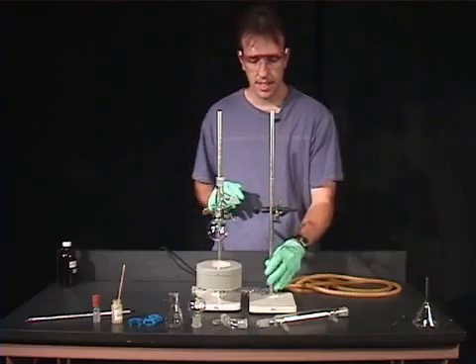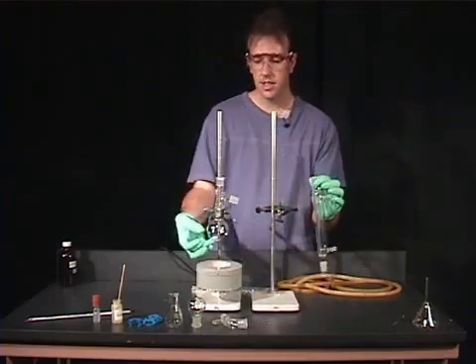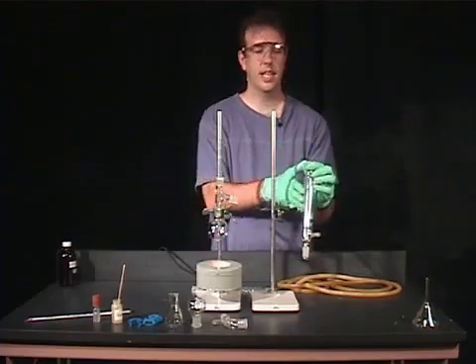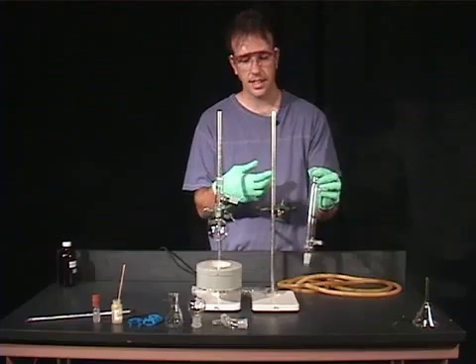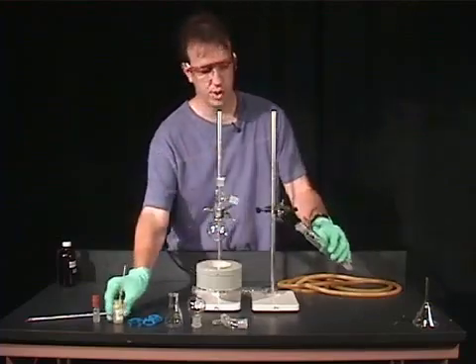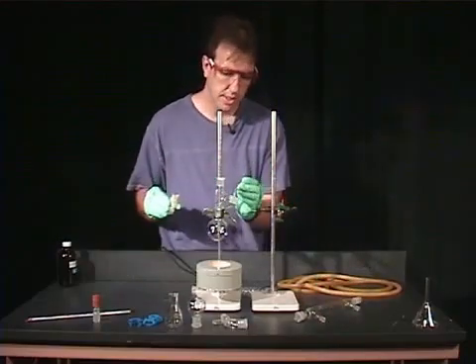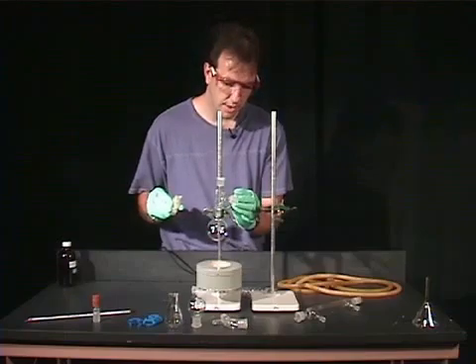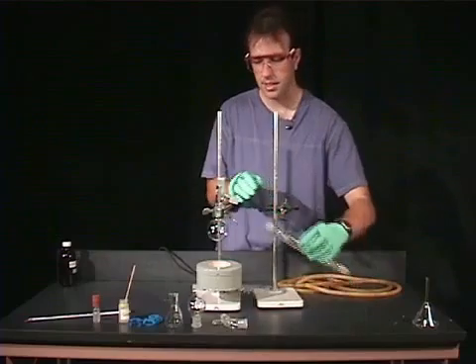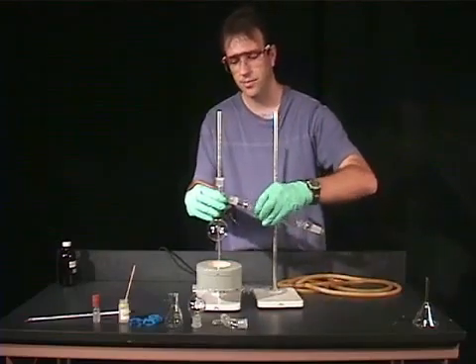The next thing we'll add is our water jacketed condenser. The liquid is heated, it vaporizes, and then as it goes through the water jacketed condenser, it will condense. And it'll still be vapor, so we need to grease this joint as well. So I'll add a little bit of grease again, just a little bit towards the top of the joint at two points, 180 degrees apart. And before I clamp this, I'll put this on there and rotate that around so we get a nice seal.